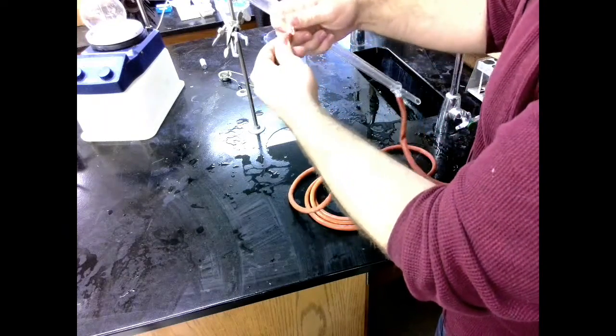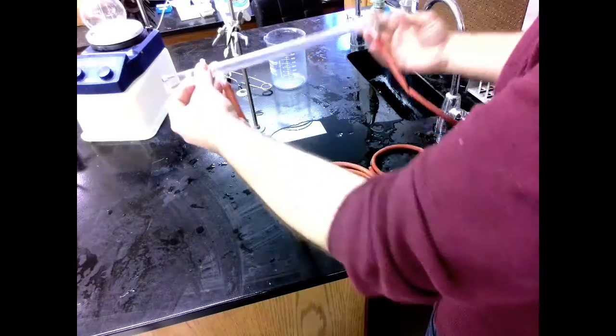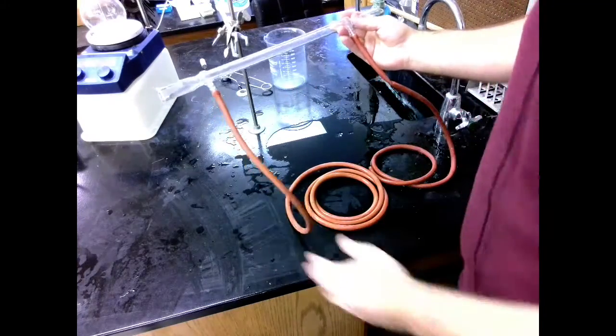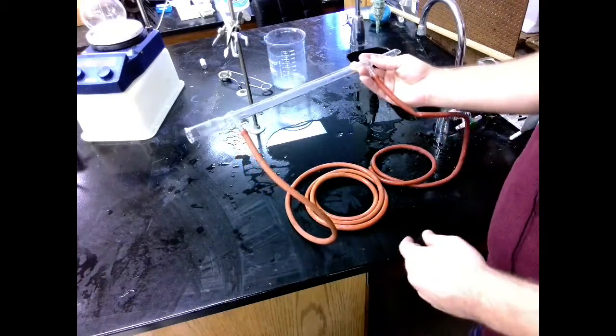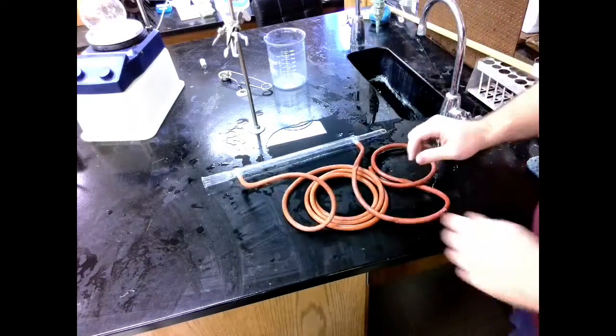And then my longer tube will fit on my outlet port. And this will just be going to the drain. So I'm fitting this on. Notice it's just on one notch. We're not going to be putting enough water pressure through this to really push these off. So now let's connect it to my clamp and connect it to my water.